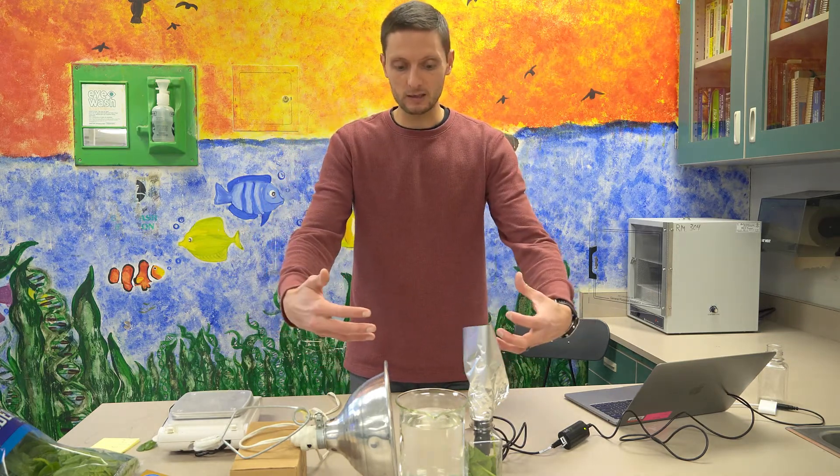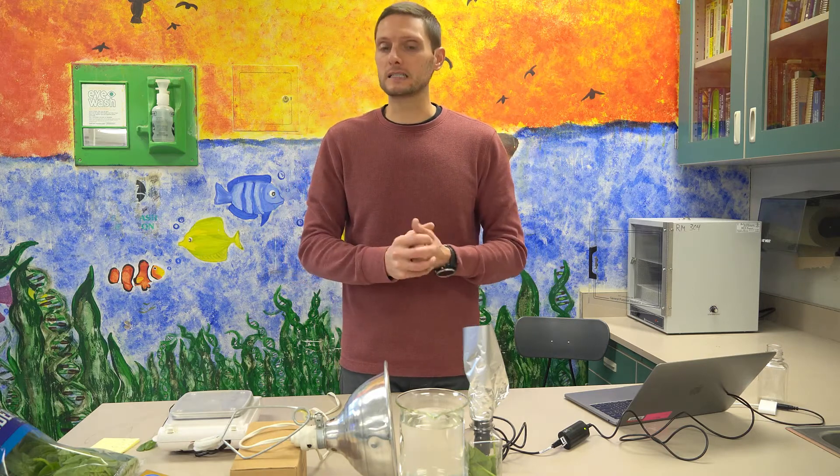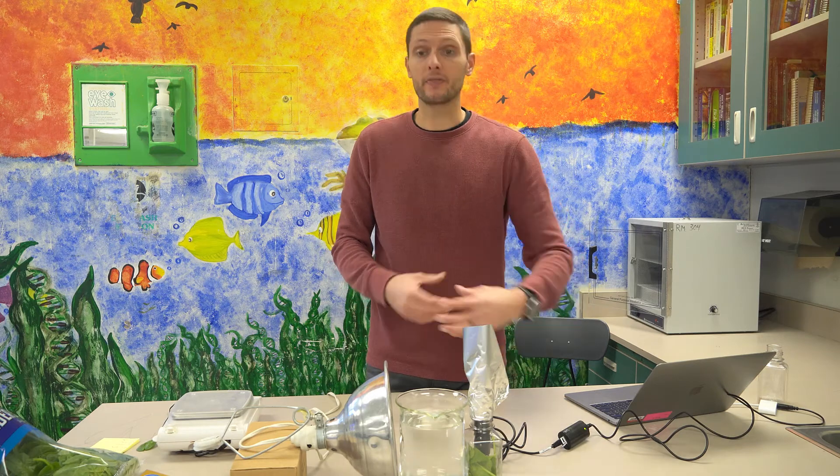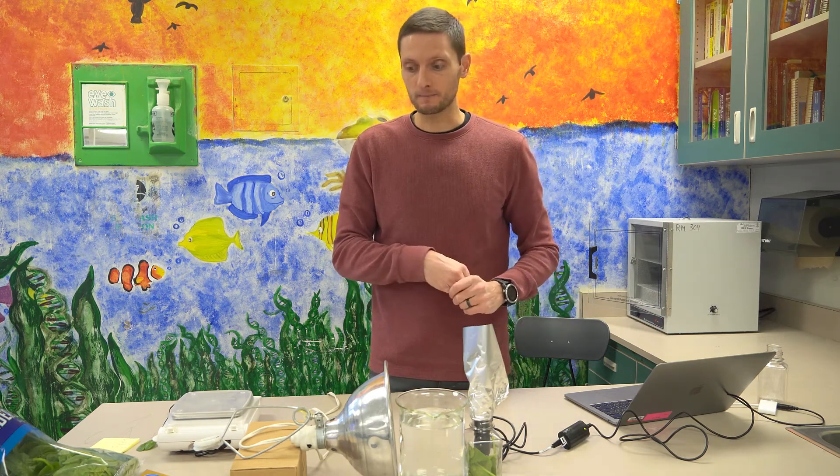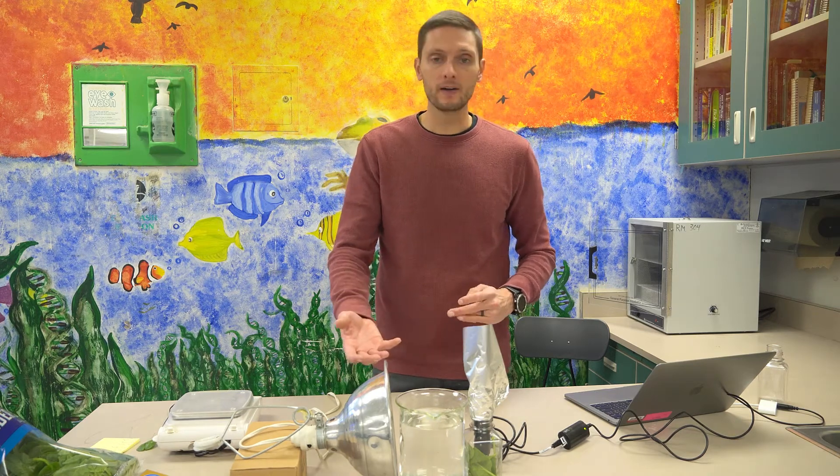And I've got everything as close as possible to this thousand milliliter beaker that I filled up pretty much all the way. The amount of water doesn't really matter as long as it's covering the area that the spinach is within the biochamber. So I'm going to let this sit for, we've got about another minute and a half, and then we'll begin collecting data.